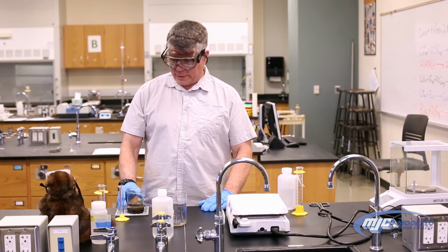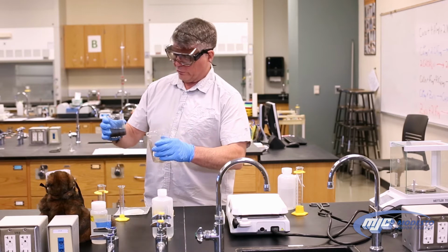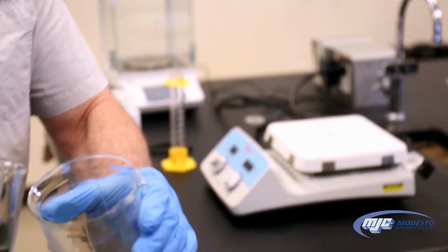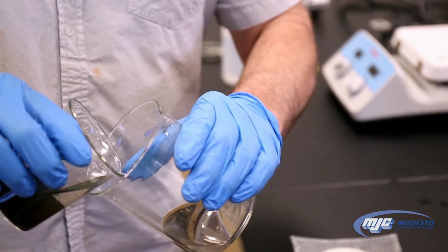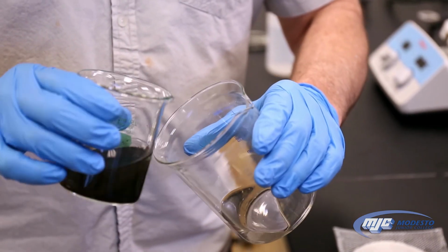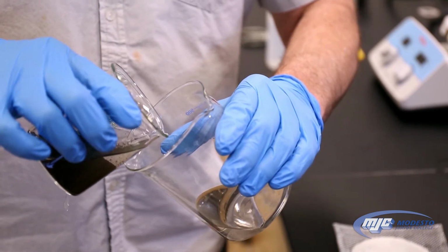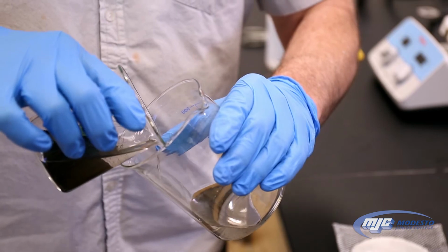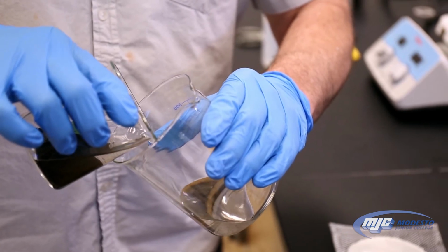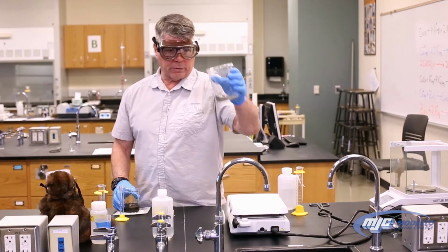All right, guys, so now that we gave the copper(II) oxide a chance to settle down, we're going to decant the last washing off the top. Again, we really don't care about getting all of that liquid out. Our goal is just to try not to let any of that, or as little of that copper(II) oxide get transferred over as we can. Yep, a little piece went over. I'm going to call that good enough. So now this, we can just throw down the drain.